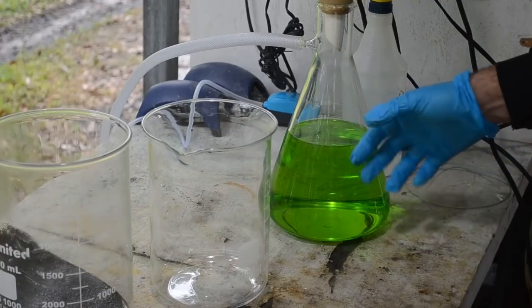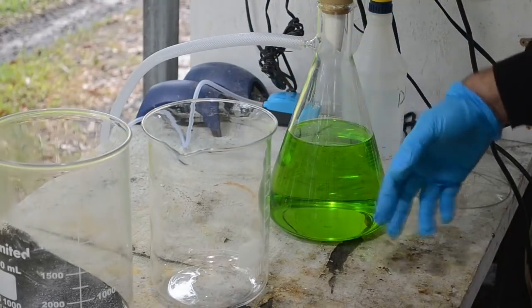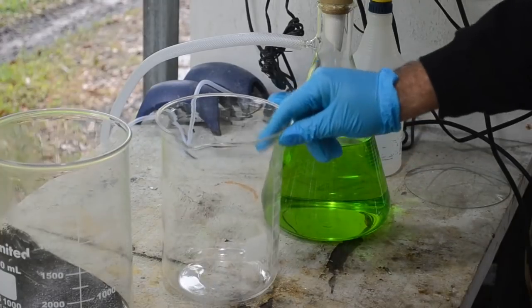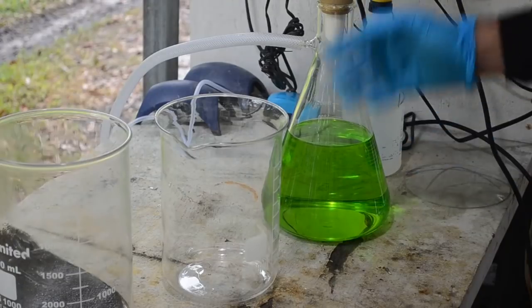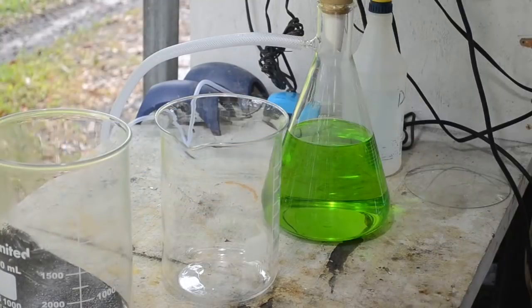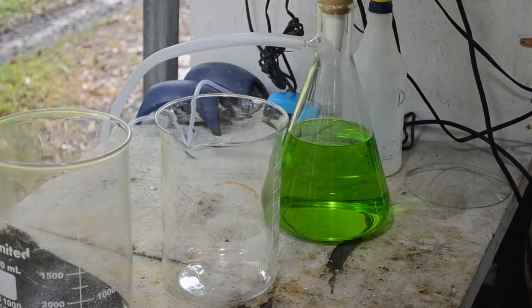One problem is though is I've got almost 2 liters of liquid in here, and I've still got to get the solids in and rinse them. So I'm going to dump this liquid off back into this beaker it just came from. I've cleaned it. And then I'll dump the solids in and rinse them and let the vacuum pull all the liquid out of them. And I'll put all the resulting liquid back in this beaker after I clean it. Because this is a 3-liter beaker, it can hold more. So yeah, I definitely need to reduce the amount of stuff for the next run. This is just too much to handle. Too much back and forth and shuffling around.